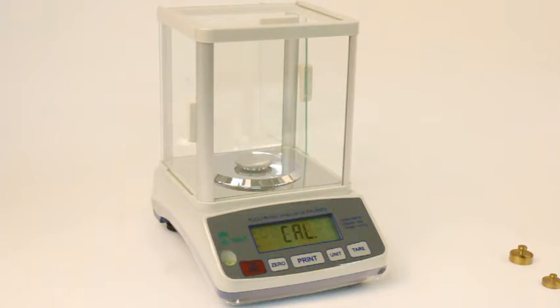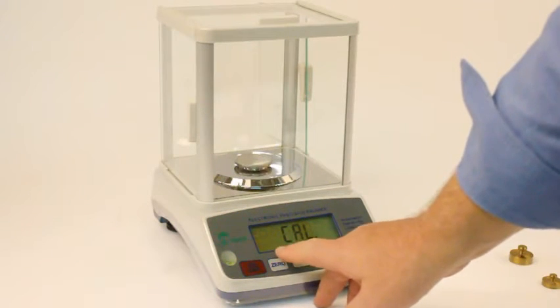We are now in the calibration mode. If we press the zero key again, we will receive the calibration prompt.